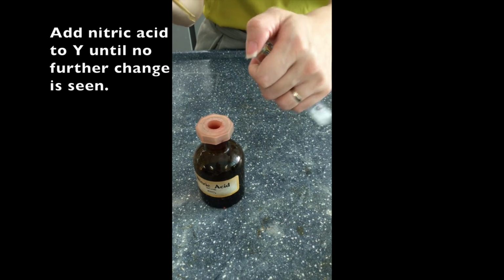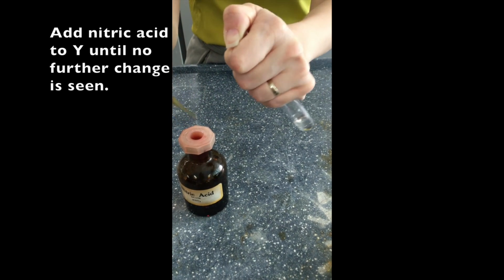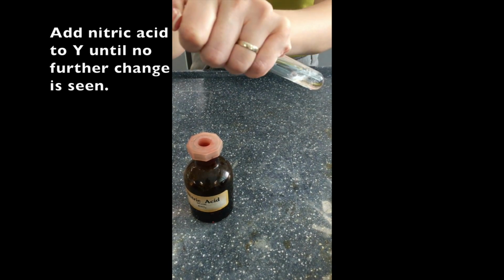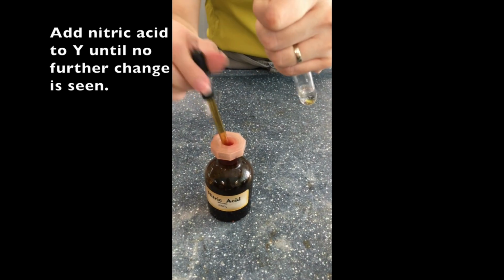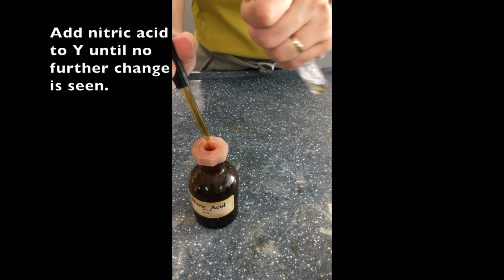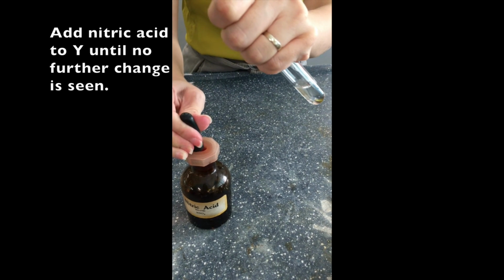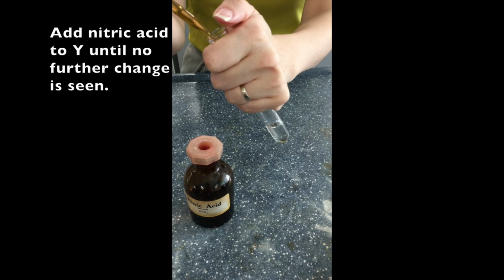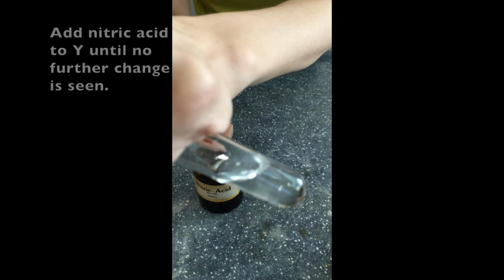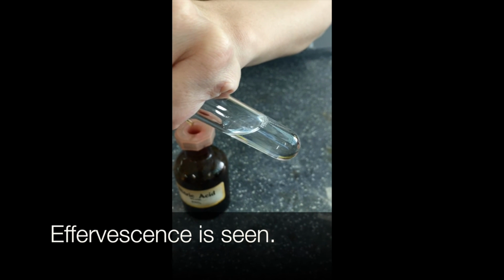So we do the same for Y. And you can feel and see that there is some effervescence. So to test for the gas produced, we need to be patient and allow more gas to be produced before we bubble it through lime water. So first observation, effervescence is seen.